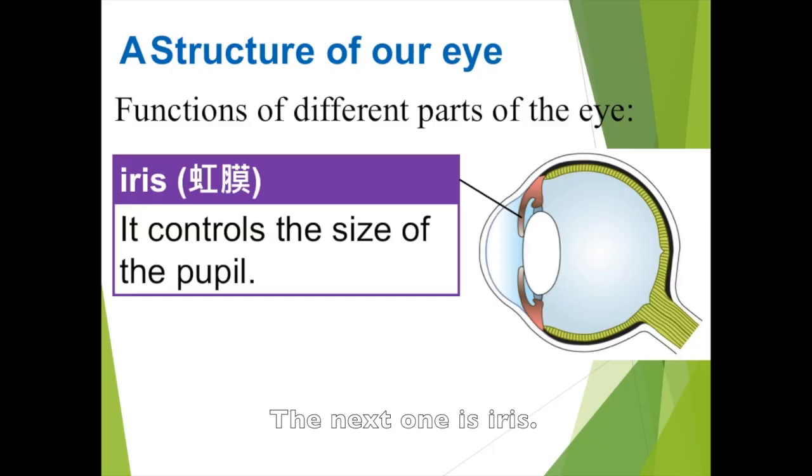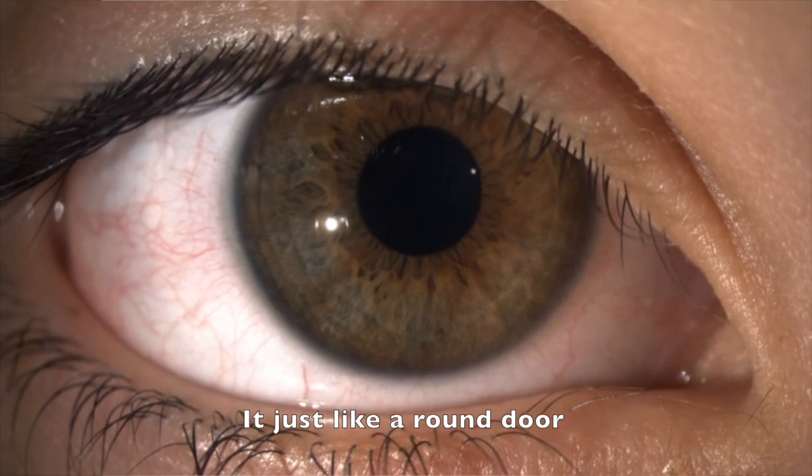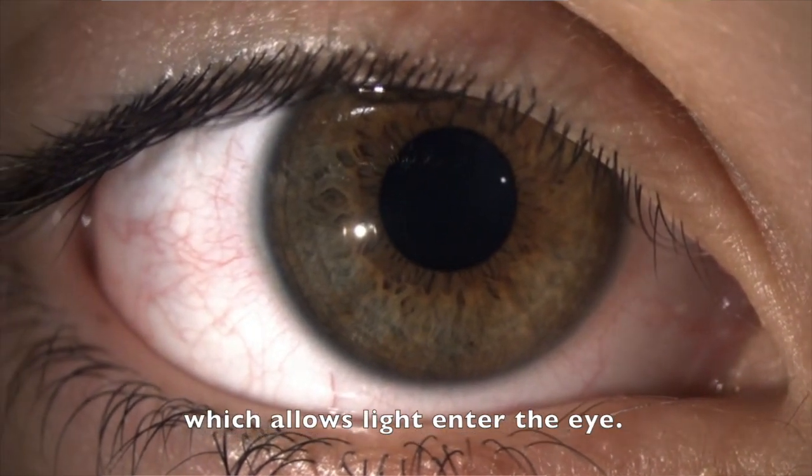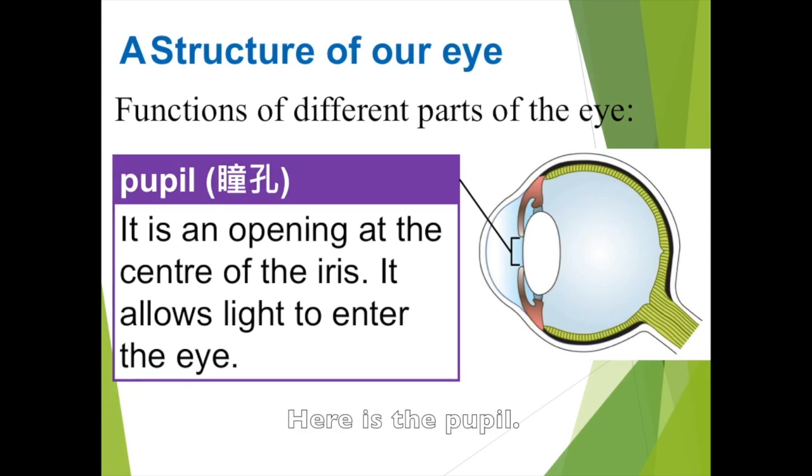The next one is the iris. Different kinds of people may have different colors of iris, and it controls the size of the pupil. It's just like a door in a circle shape, which lets the light enter into the eye. And here is the pupil, an opening at the center of the iris. It allows light to enter the eye.